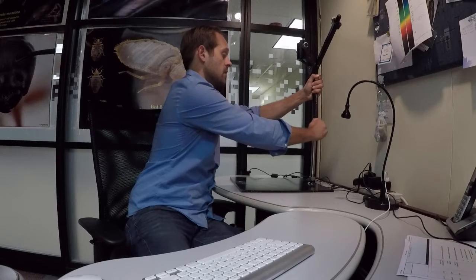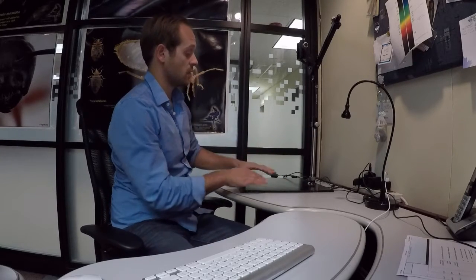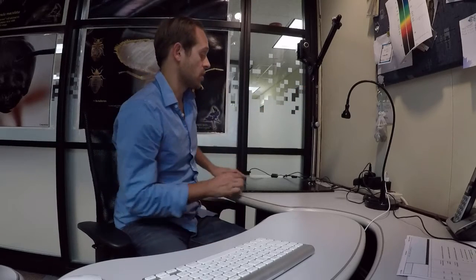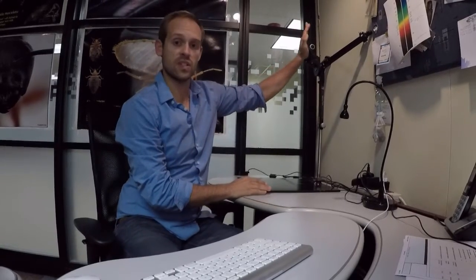You can set the camera up in a couple of locations — up here or down here — depending on whether you're using the petrographic analyzer or just focus stacking a large slab of rock. For photographing a large slab, we'll have the camera oriented down here. A useful trick to further stabilize the setup is to bend the legs back to the 30-degree position and brace them against the wall, giving you a really solid, sturdy base with minimal vibration.